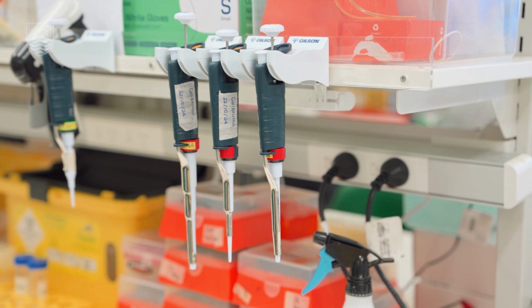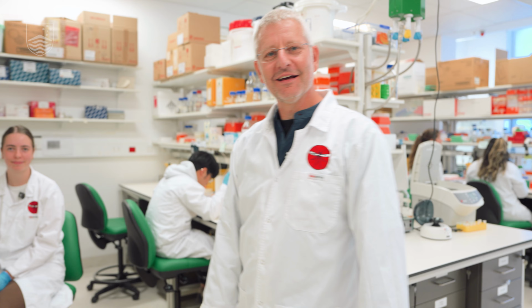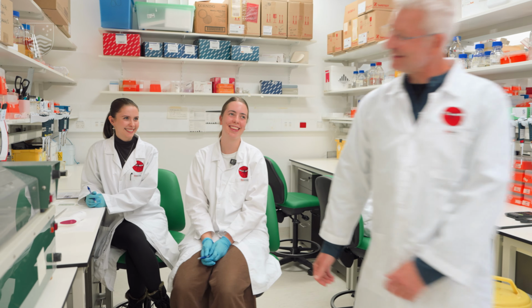So we look at different parasites here in our laboratory, and we try to find new ways to fight those parasites. This is our first stop, and we have Sabina and Lizzie here, and they're going to show you something about poo flotation. Take it away. Thanks, Alex.